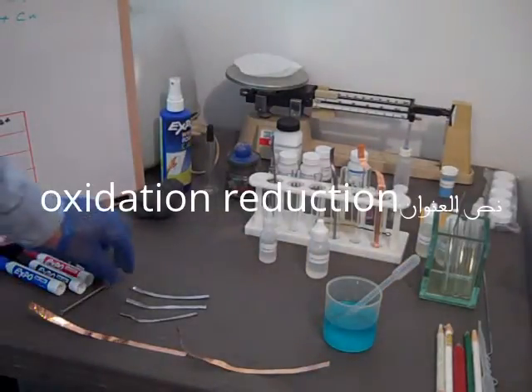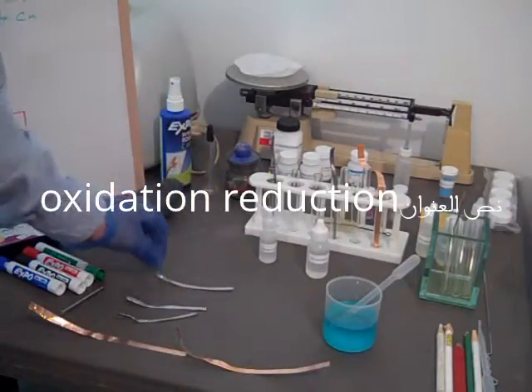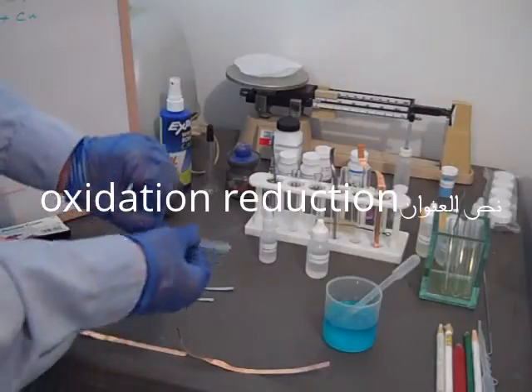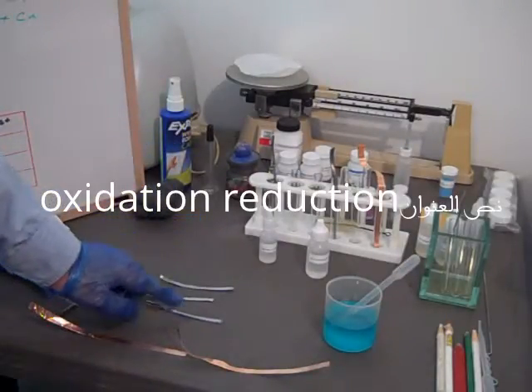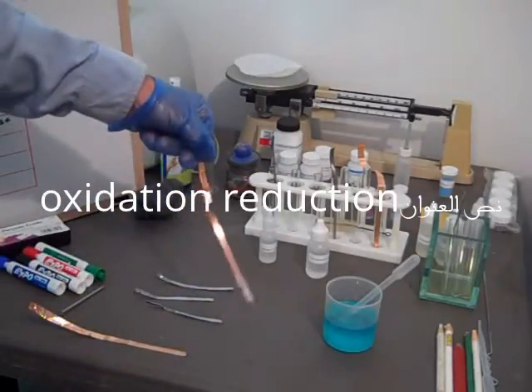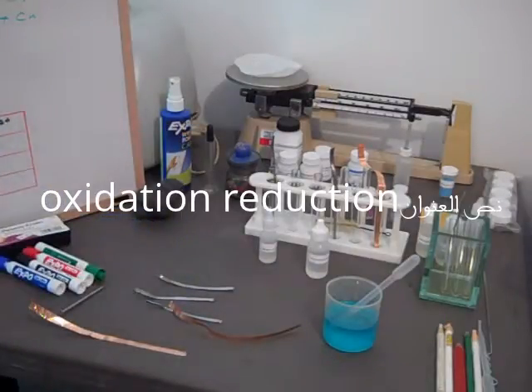We've already cut some strips of lead and polished them with steel wool so that we can see them if they react. You see the lead—it's a very soft metal. We got that from roof flashing material, and the same way we got copper strips.